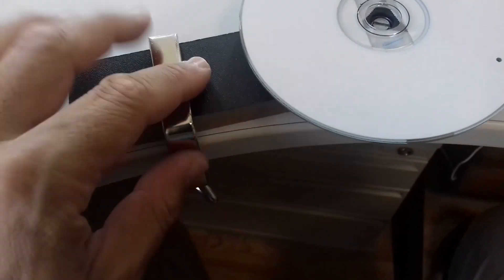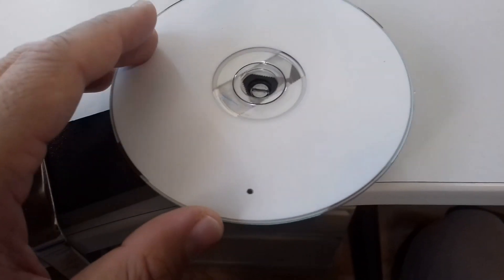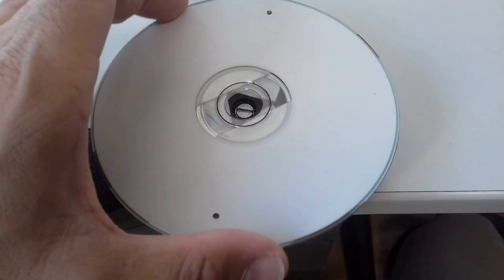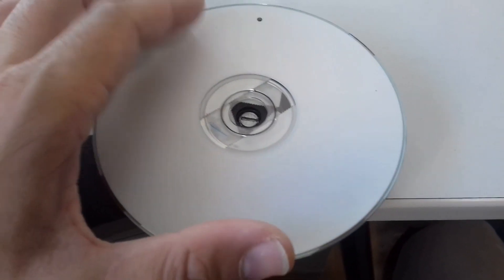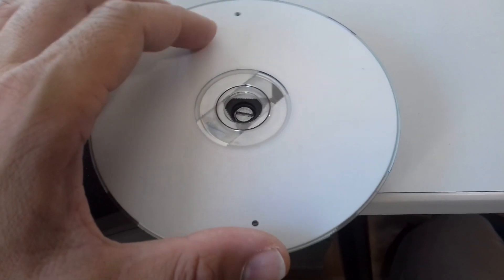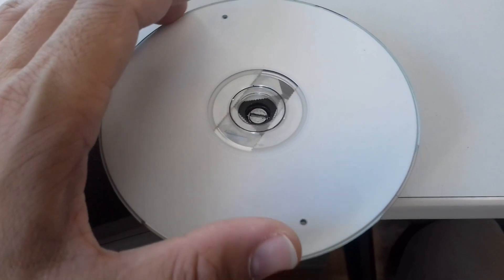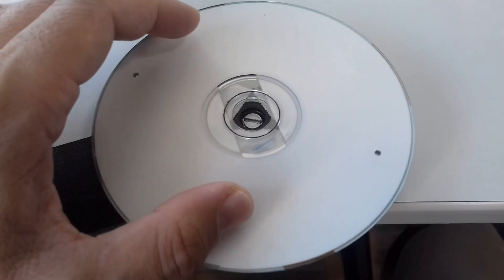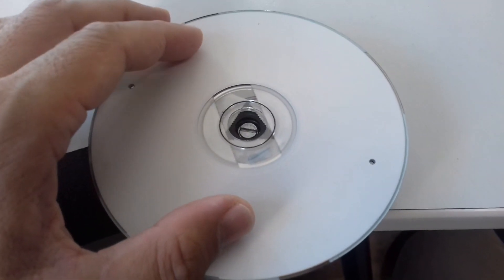It's relatively easy to make. It is a little bit wobbly, but that's okay. It's definitely not as wobbly as the plastic wheel, and the rotation also stabilizes it a little bit.